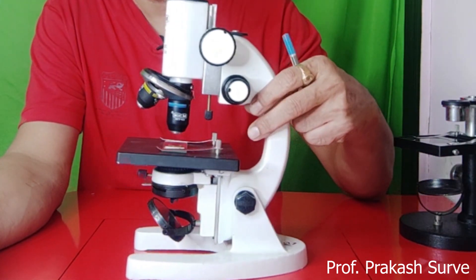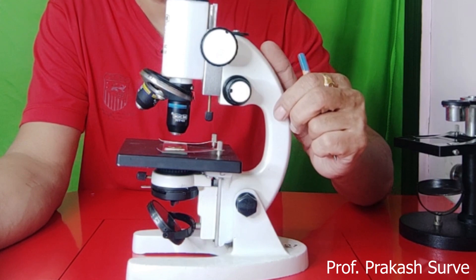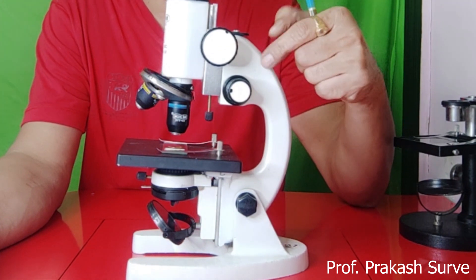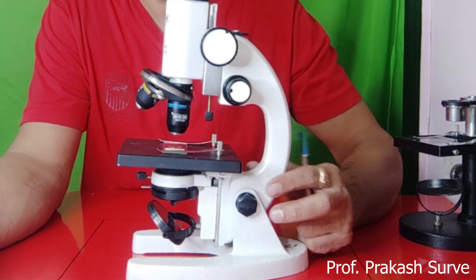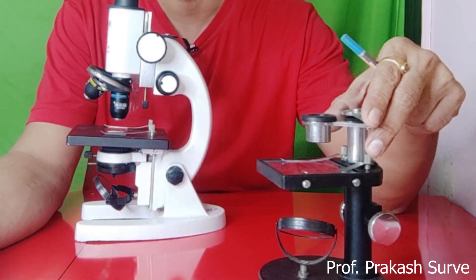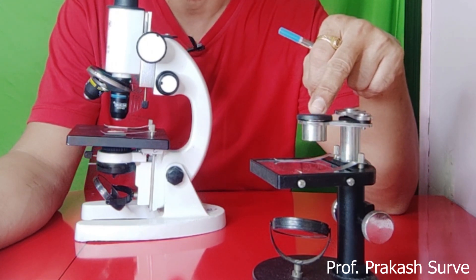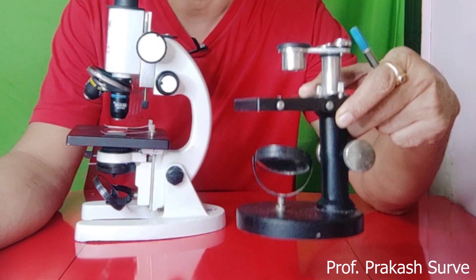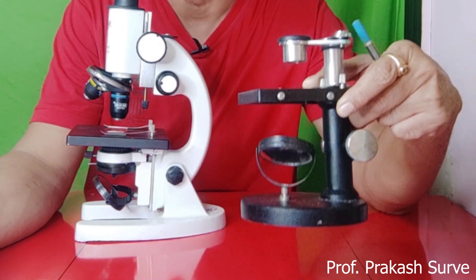The compound microscope has a much higher resolving power than a simple microscope. Under the compound microscope, we study small microorganisms, as well as tissues and cells. The dissecting microscope is a simple microscope with a single lens, used to dissect small organisms and their parts — such as the housefly, cockroach, and different flowers.